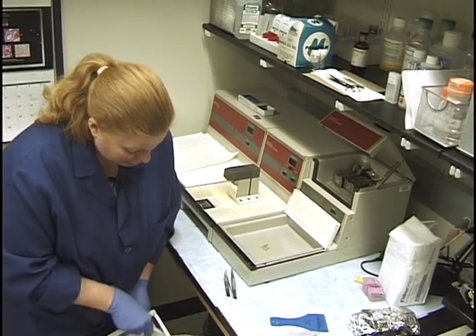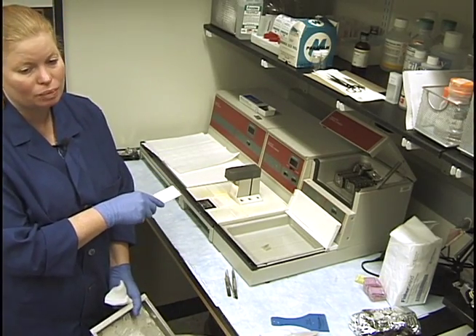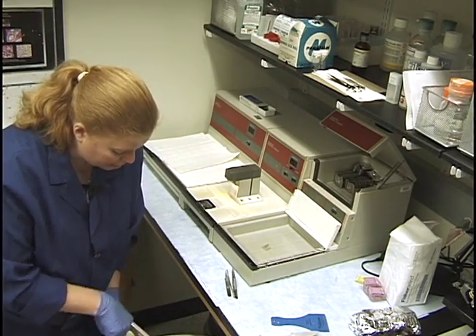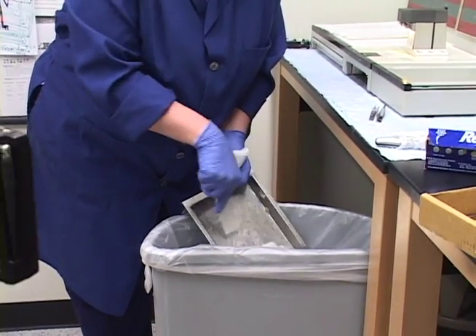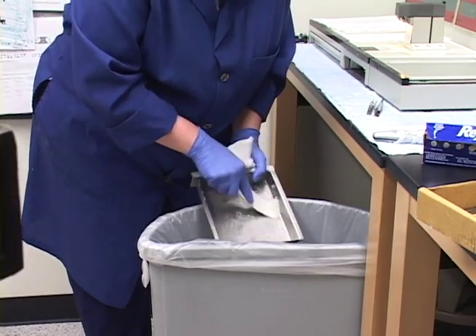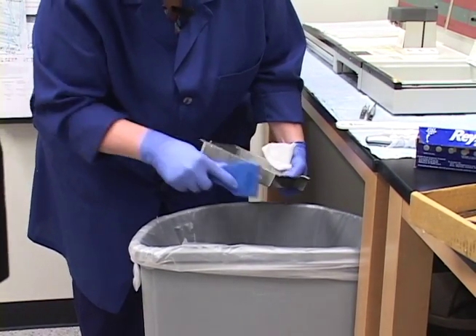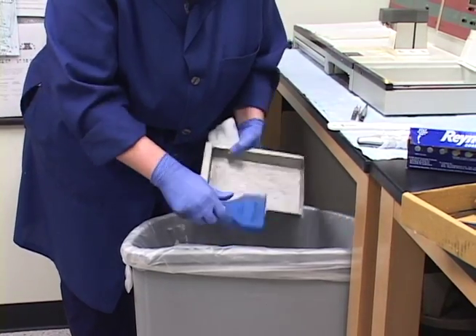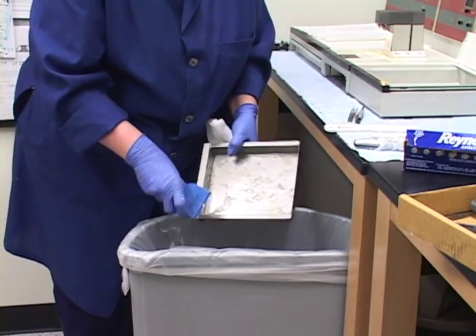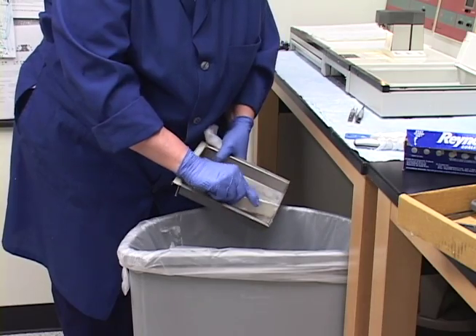It's kind of thick to get done, and if you're neglectful on this tray it can actually get paraffin back into the unit and break it - we've already had a service call on this once. So make sure to do this tray. This cleanup is very important to this particular machine, it's not just being picky. Make sure to get these edges so paraffin doesn't get down into the unit.